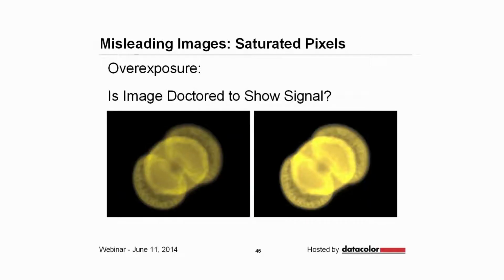This one is probably the number one problem with images, and I see it so often, it literally drives me nuts. Why would you acquire an image and then literally remove the details in the brightest part of the image? You can see in the image on the left all of the detail in this pollen sample, but on the image on the right, some of the detail is blocked and you have saturated that part of the signal.